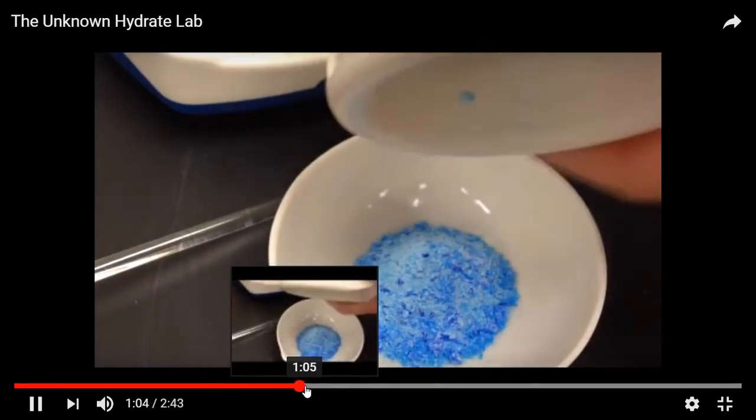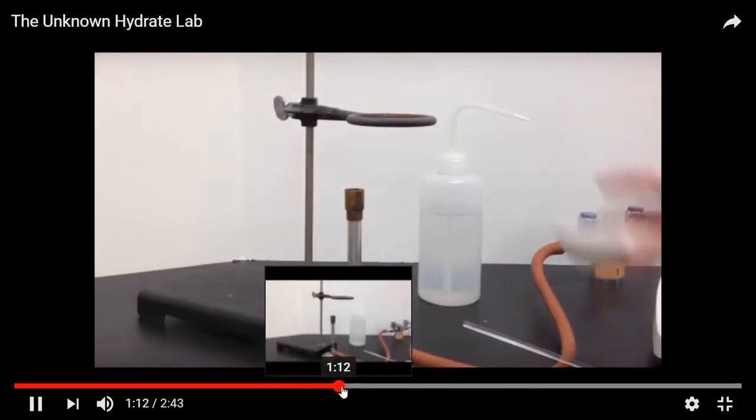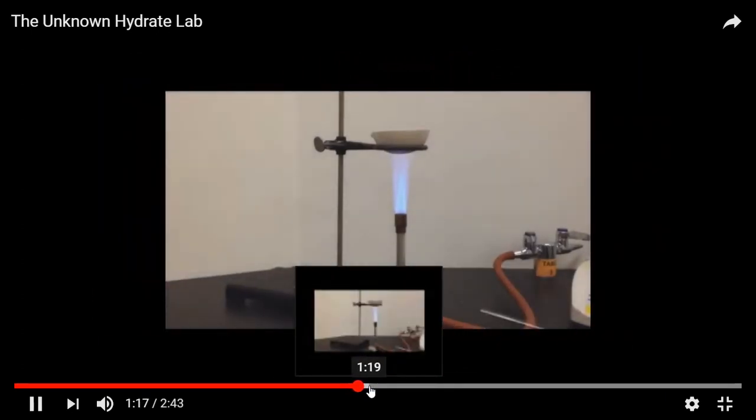Transfers it into a dish, and then we heat it because the best way to get rid of the water is to heat it.